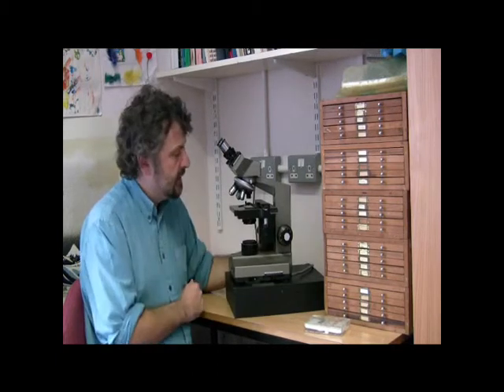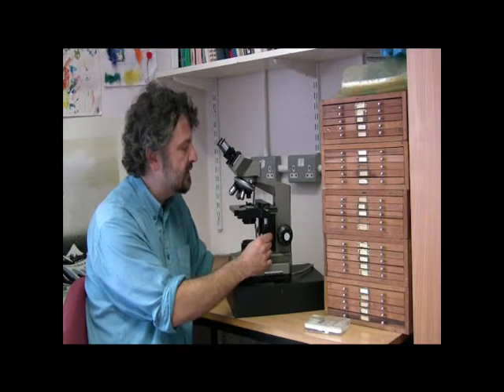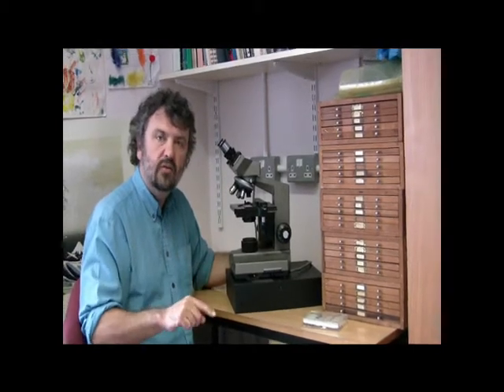We can look at the radiolaria like this, and I would recommend that you adopt a systematic approach to looking at radiolaria under the microscope. I tend to start in one of the corners of the slide and work my way across, going down then systematically and back across. For statistical reasons, you really only need to count about 300 radiolaria. On a slide like this I can tell there are several thousand radiolaria, so I wouldn't want to count all of them and I don't need to examine the entire slide.